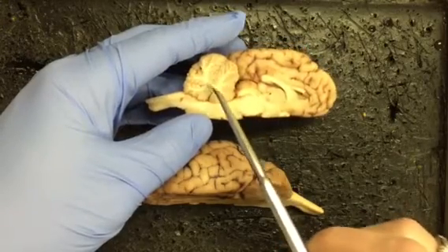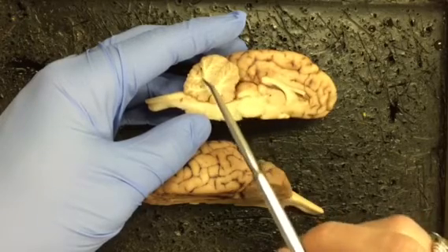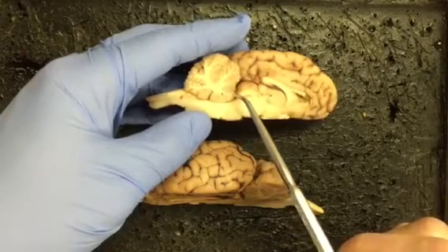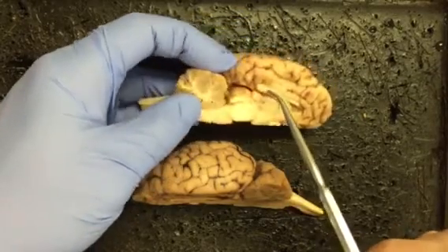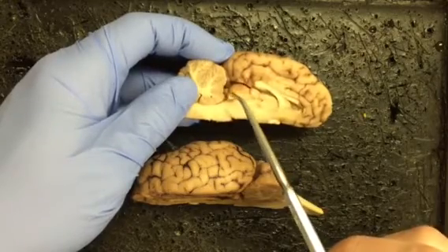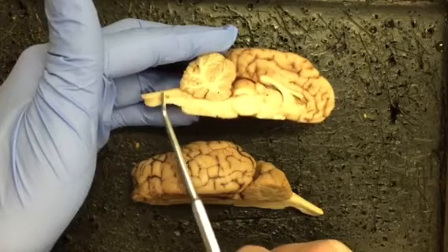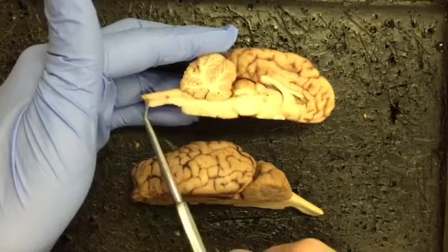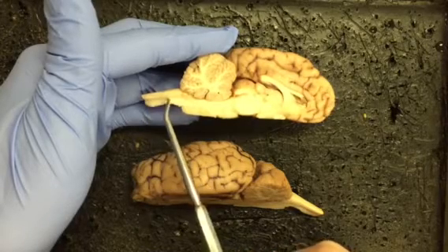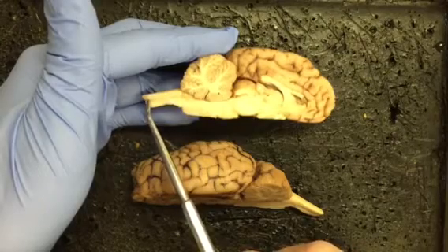You'll notice that it has white fibers in the middle for white matter and gray matter on the outside. It actually looks like a tree. It's called the arbor vitae, the tree of life. We have the superior colliculus, which we saw earlier. This is its side view, and this is the inferior colliculus right there. The spinal cord extends posterior to the cerebellum. The central canal is this dark region that goes through the center that continues the flow of cerebral spinal fluid as it goes from the 4th ventricle down into the spinal cord.